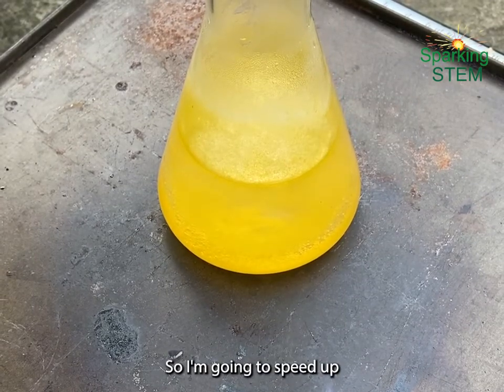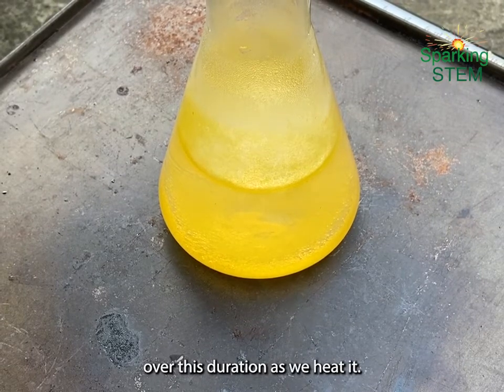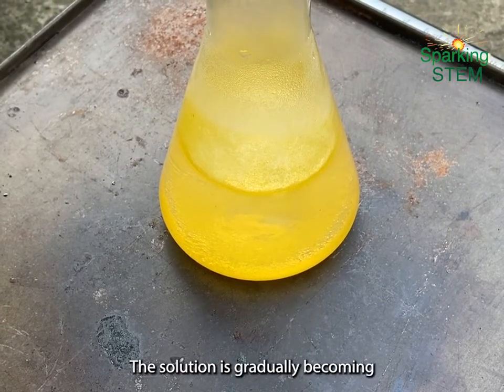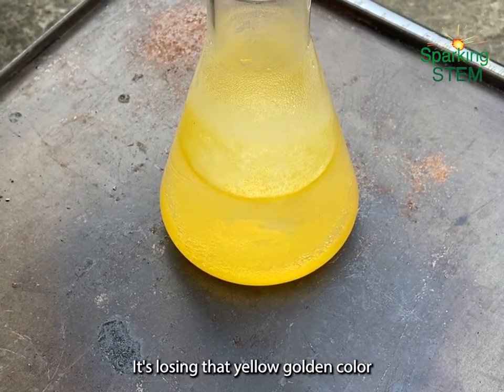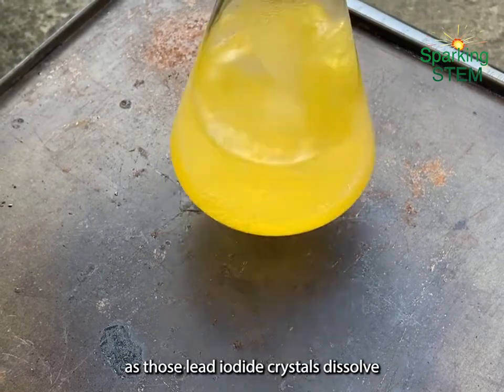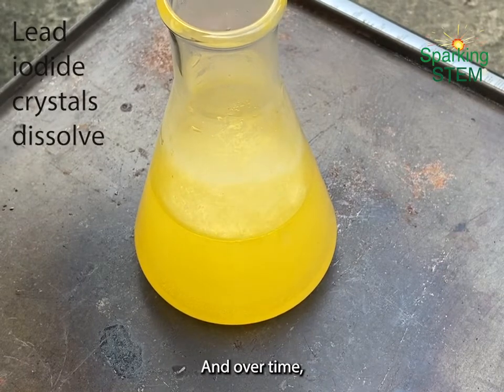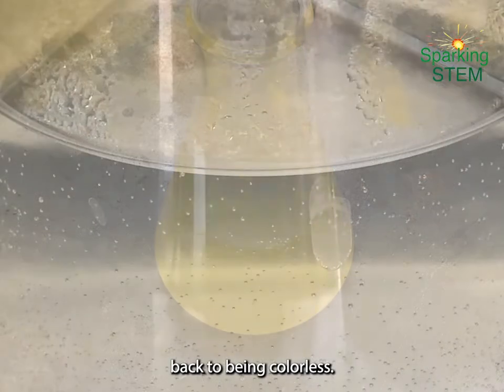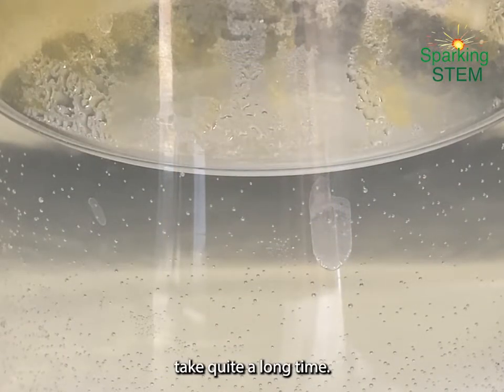Now it takes quite a long time for it to get back to a completely colourless state, so I'm going to speed up this recording here, and you can hopefully see that over this duration as we heat it, the solution is gradually becoming more and more colourless. It's losing that yellow golden colour as those lead iodide crystals dissolve. I'm giving a little shake every now and again, and over time it gradually goes back to being colourless. And I've skipped ahead here because that really did take quite a long time.